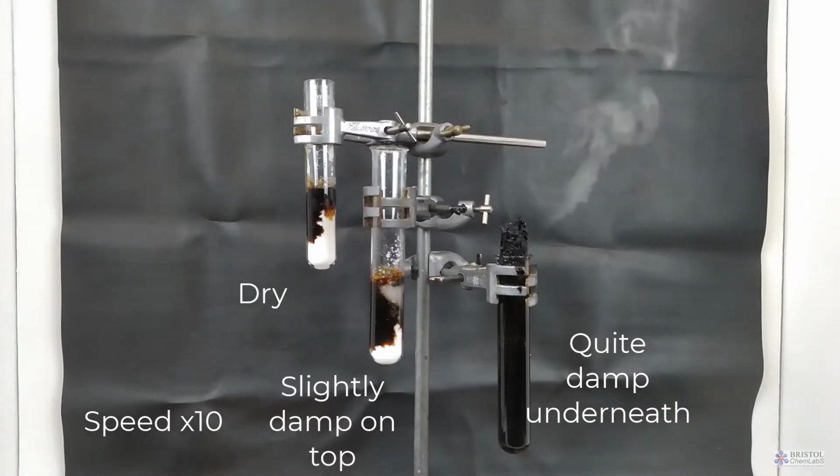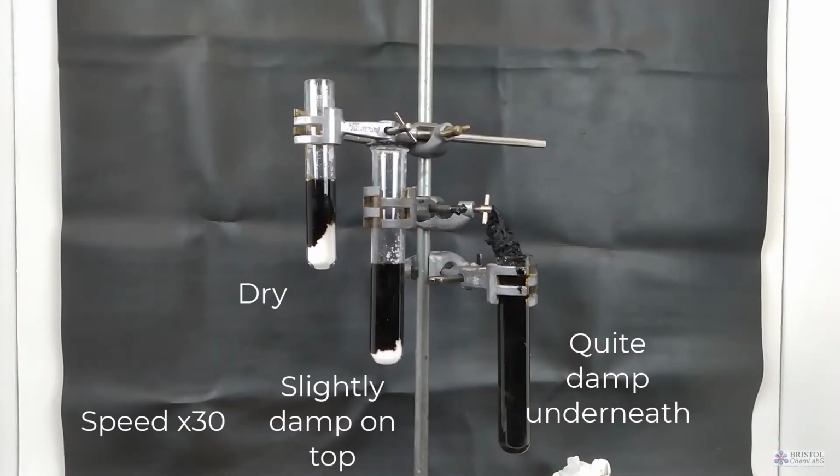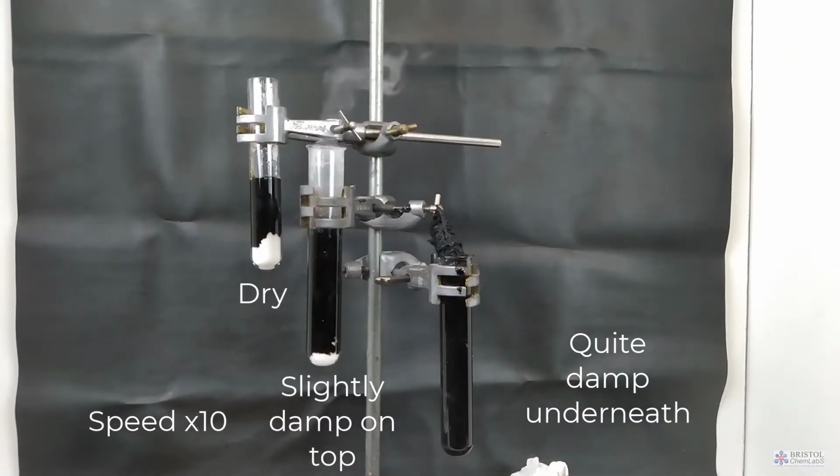The dehydration is a property of concentrated sulfuric acid. You could demonstrate that 2 molar sulfuric acid doesn't have a dehydrating effect. It doesn't remove the elements of water from the sucrose.